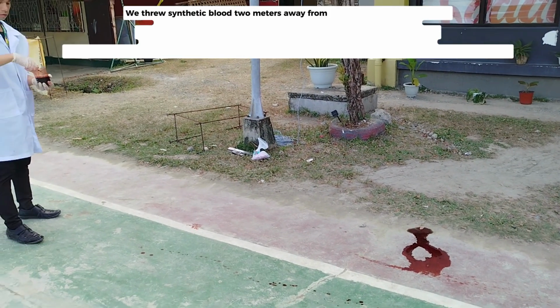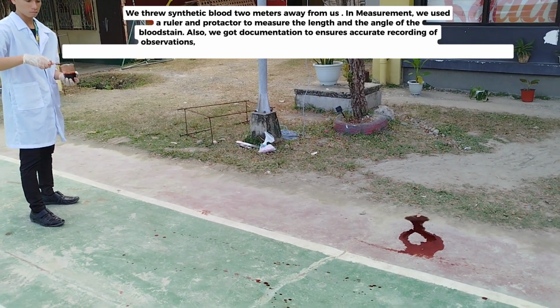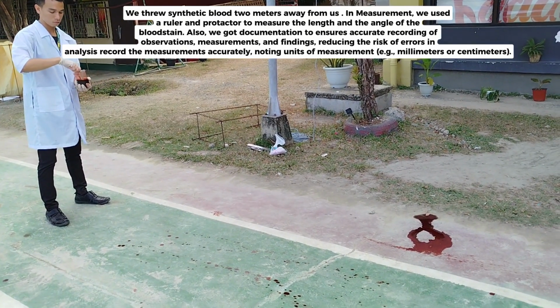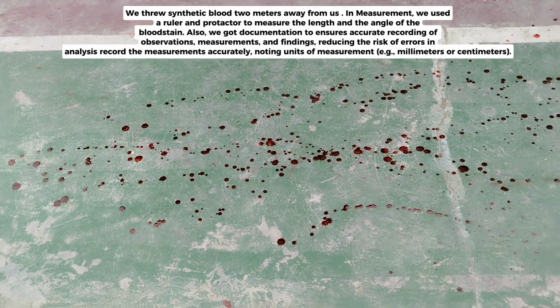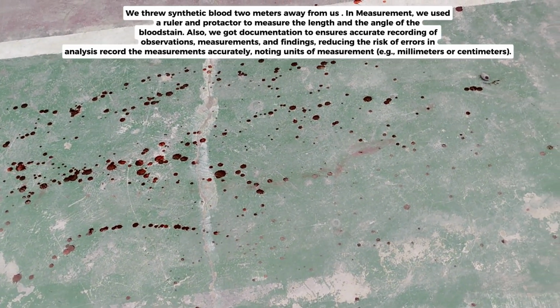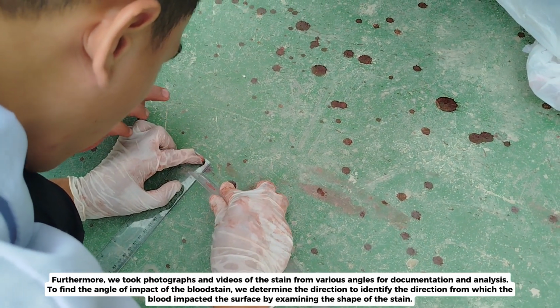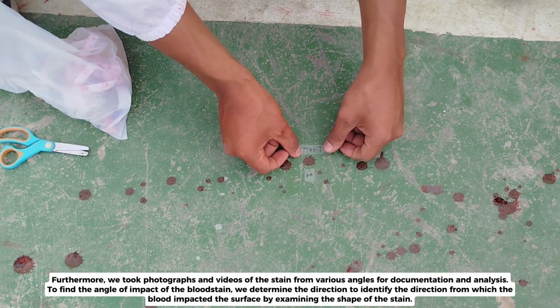We threw synthetic blood 2 meters away from us. For measurement, we used a ruler and protractor to measure the length and the angle of the bloodstain. Also, we kept documentation to ensure accurate recording of observations, measurements, and findings, reducing the risk of errors in analysis. Record the measurements accurately, noting units of measurement, e.g., millimeters or centimeters. Furthermore, we took photographs and videos of the stain from various angles for documentation and analysis.